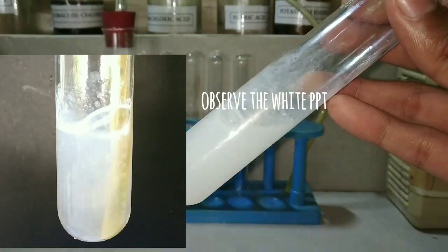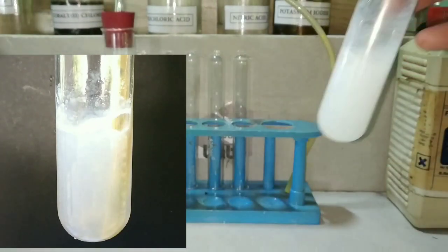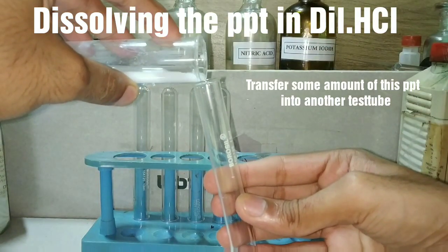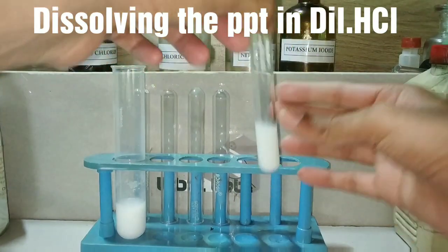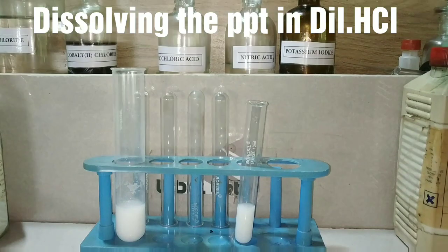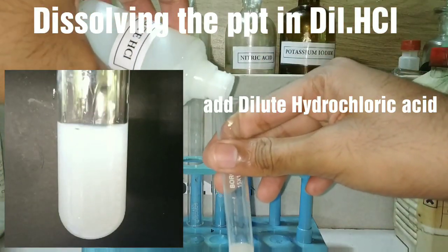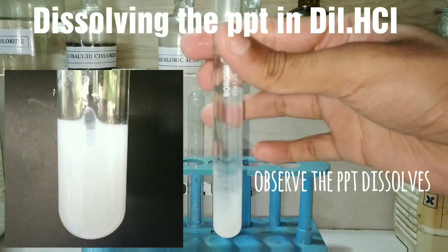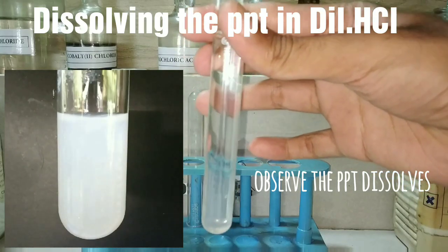I have passed the gas through the original solution and you can observe the formation of a white precipitate. The next step is to try to dissolve this precipitate in dilute hydrochloric acid. We take some amount of the precipitate in a test tube and add the dilute acid. You can observe that on adding the hydrochloric acid, the precipitate dissolves and the solution turns clear.